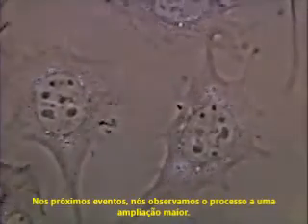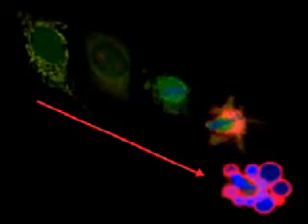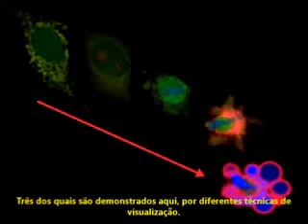In the following movies, we observe the process at higher magnification. The mechanism of apoptosis involves many tightly controlled steps, three of which are demonstrated here by different visualization techniques.